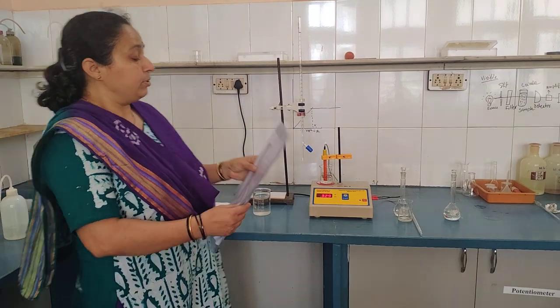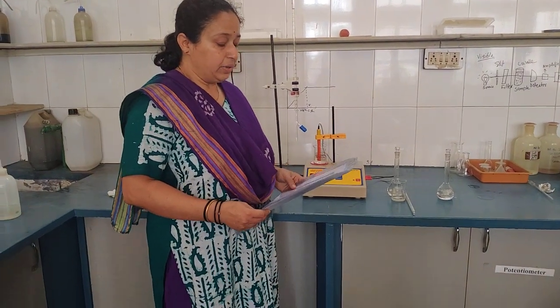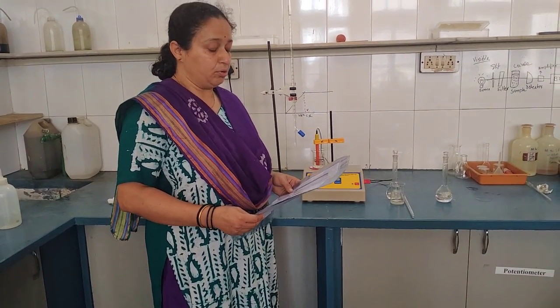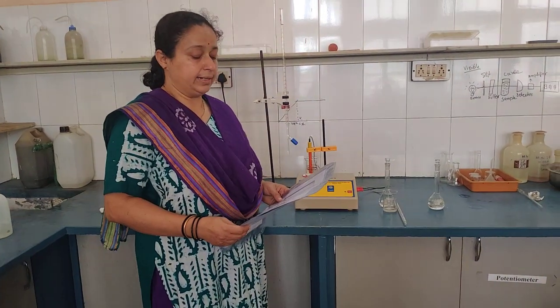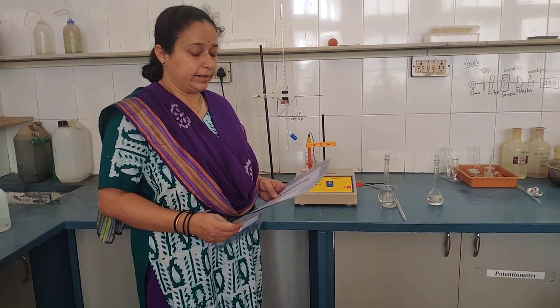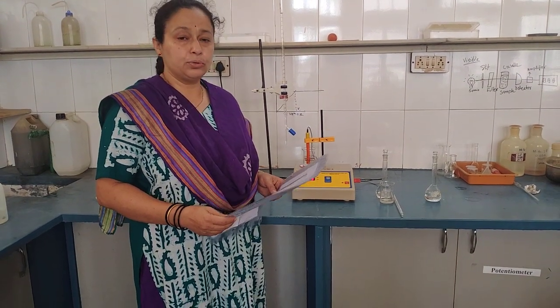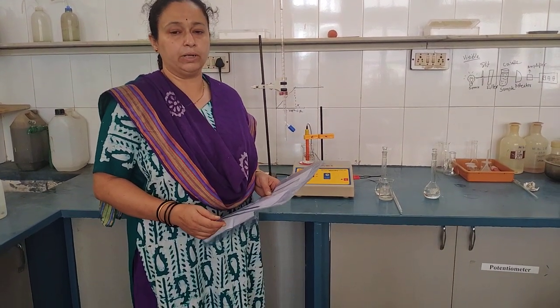I will tell you the aim of the experiment: determination of the amount of strong acid in a given solution by titration with a strong base using a conductometer.